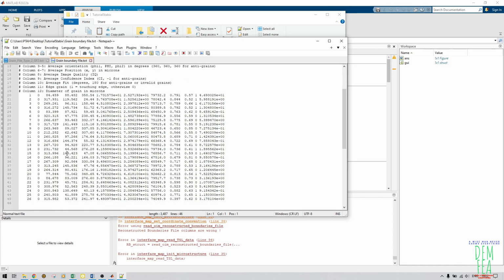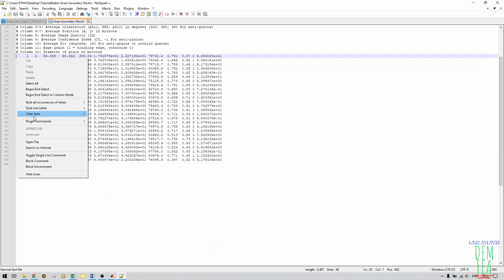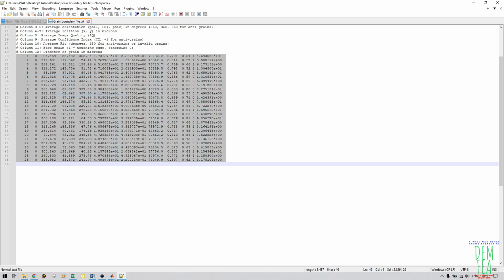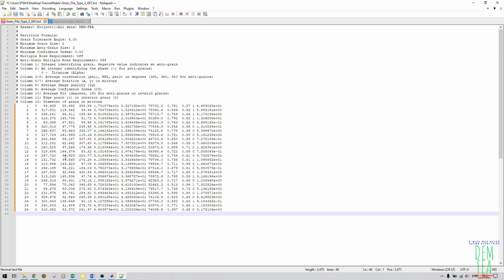These are the total number of grains in my data. I'm using Notepad++. You just right click there, begin select, and then click here, begin select, and select, copy, and then come here, and then you paste, and then you save. This one, no problem with this one, because we have the total number of columns.